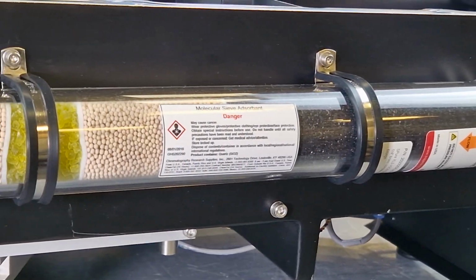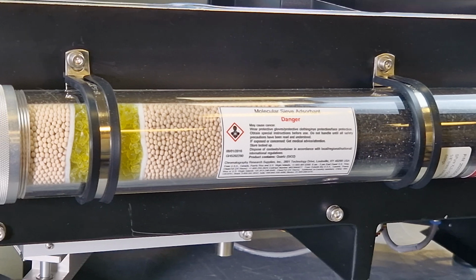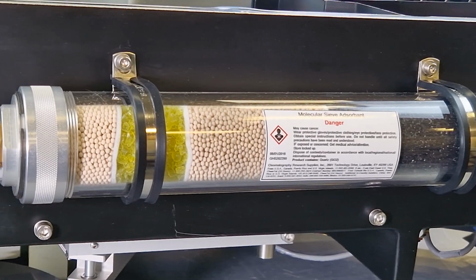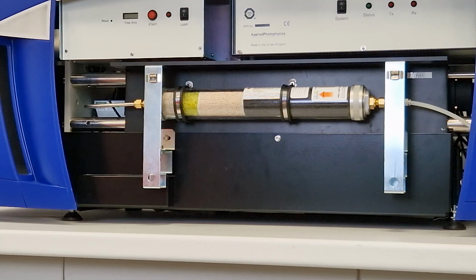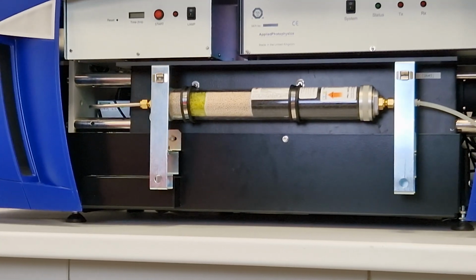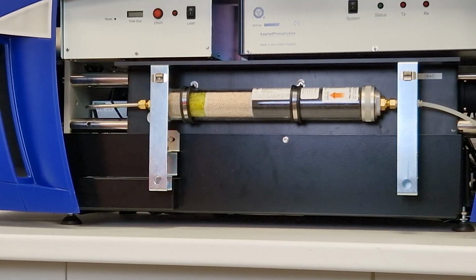From there, the nitrogen gas is guided through a filter, which ensures the nitrogen is clean and dry. Activated charcoal removes any trace of organic impurities from the nitrogen supply, which could otherwise deposit on the internal optical surfaces of the spectrometer, and a molecular sieve removes moisture. It is recommended that the filter be replaced whenever the lamp replacement is due.